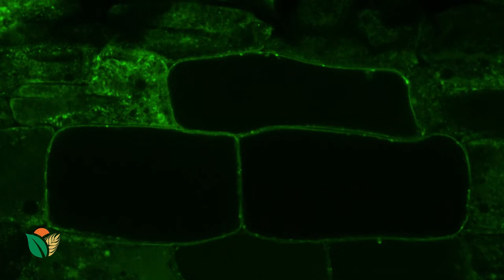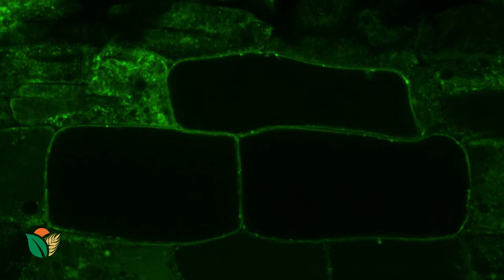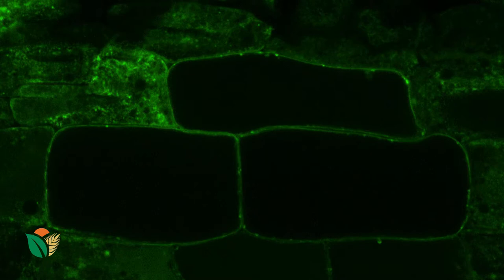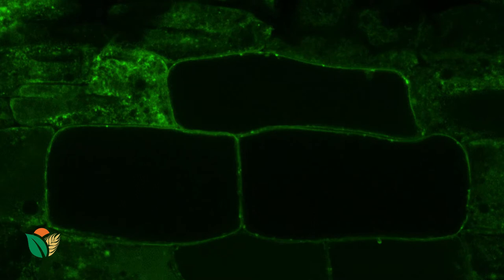In this case we see green all around the outside of the cell. That's because this specific aquaporin integrates into the exterior of the plasma membrane, and all this green that we see is lots of tiny aquaporins found in the plasma membrane.